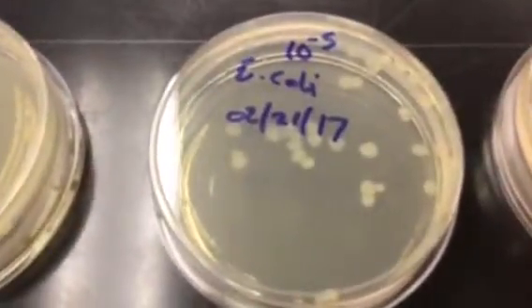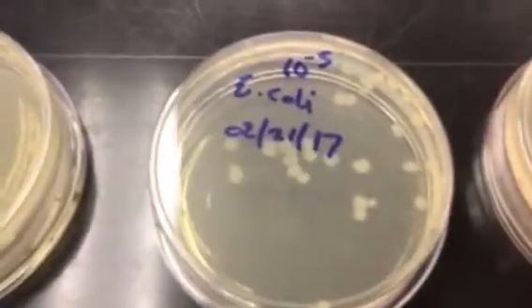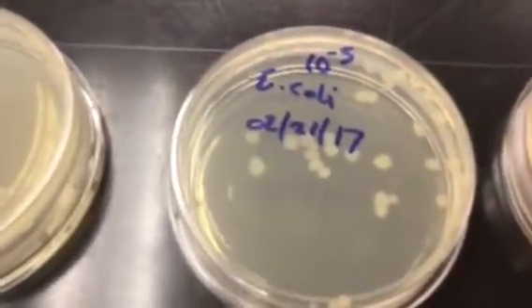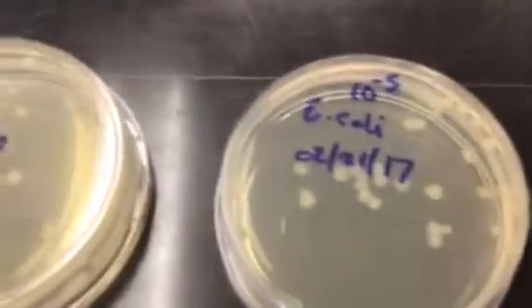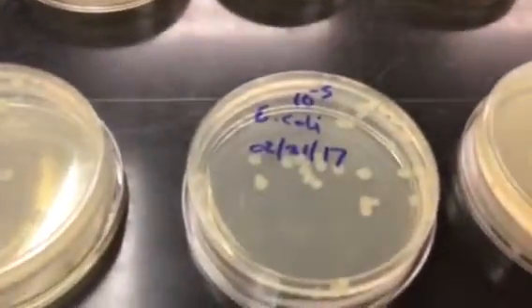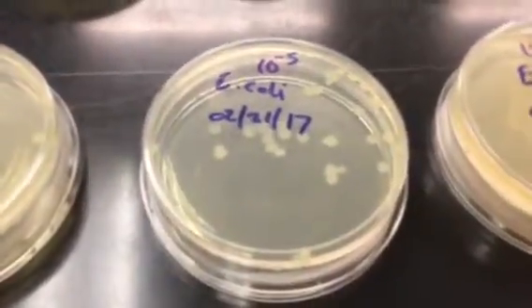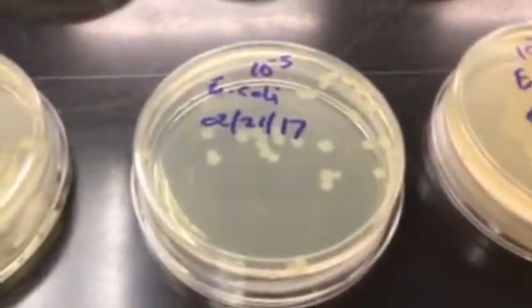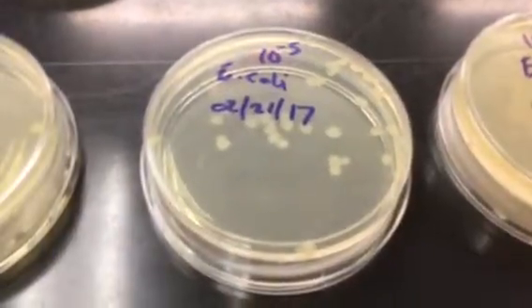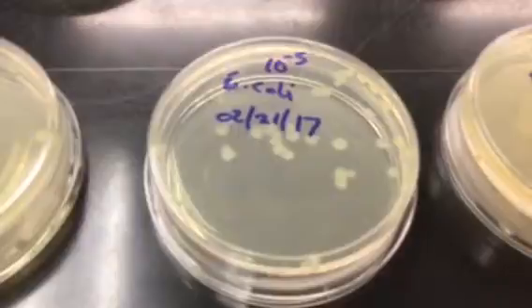I think that for this kind of thing with E. coli, you're pretty safe to do something like 18 to 22 hours, just to determine what this E. coli is doing and what the titer is. So this particular E. coli is one that we call F-amp because it's resistant to an ampicillin streptomycin mixture, and it is also the one that we use to host the bacteriophage MS2.